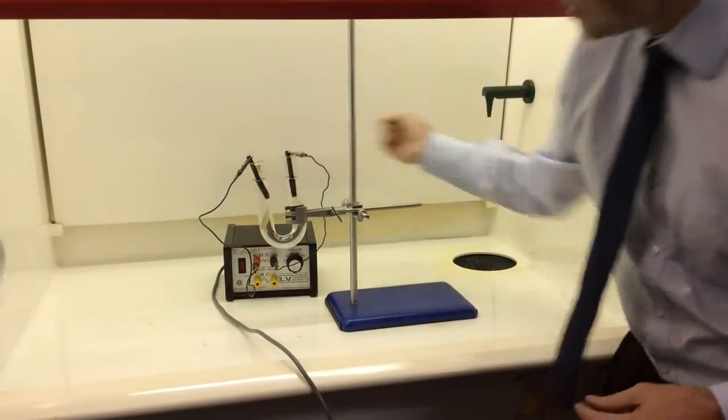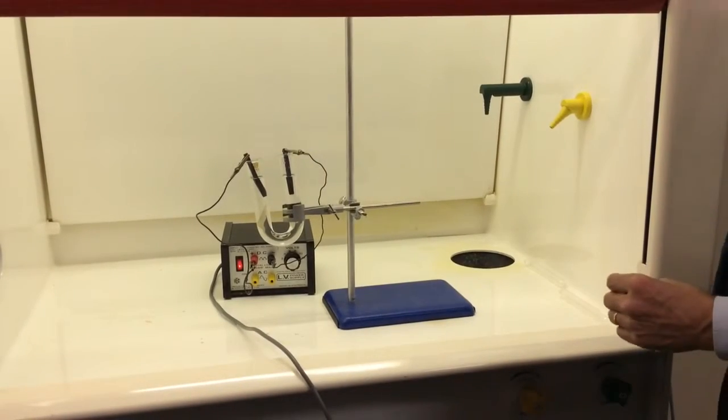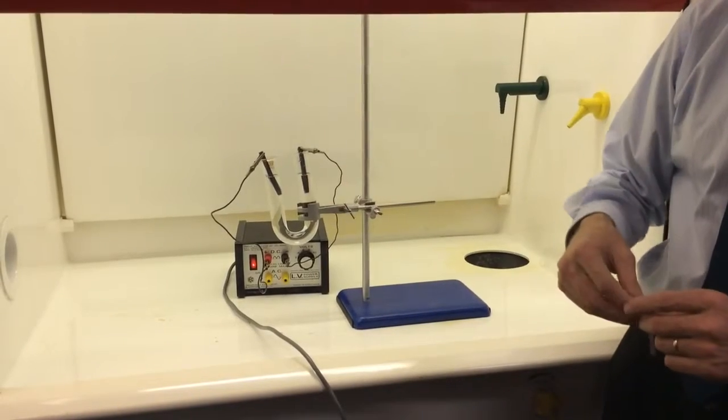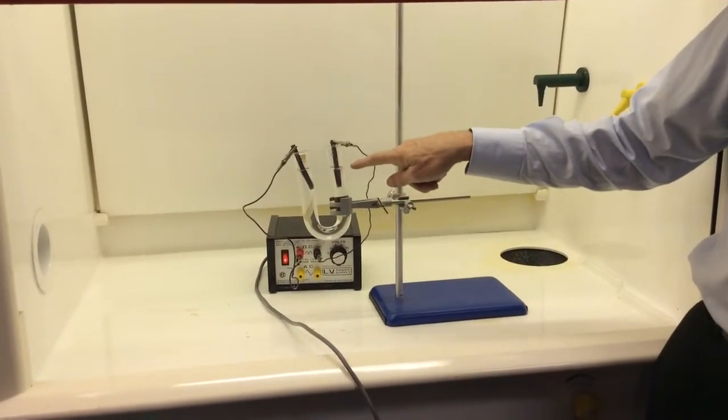So let's turn it on. First I want to see if we've got bubbles. Okay, bubbles at both ends, and this is going perfect.